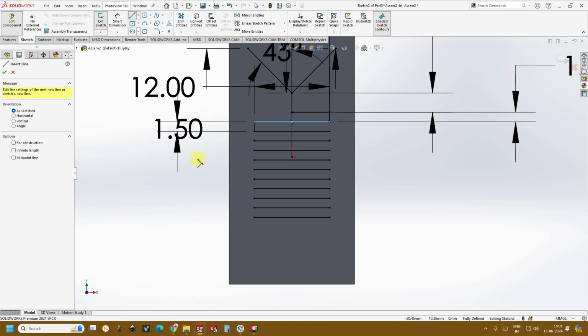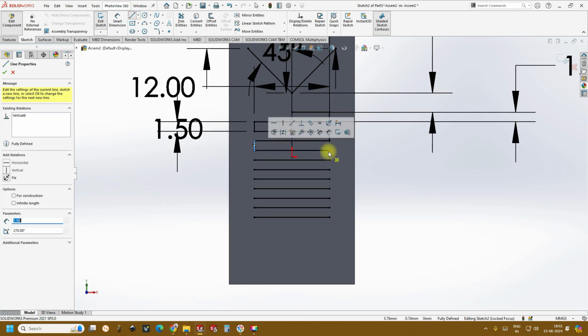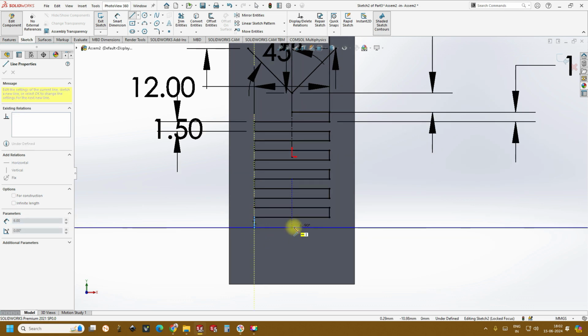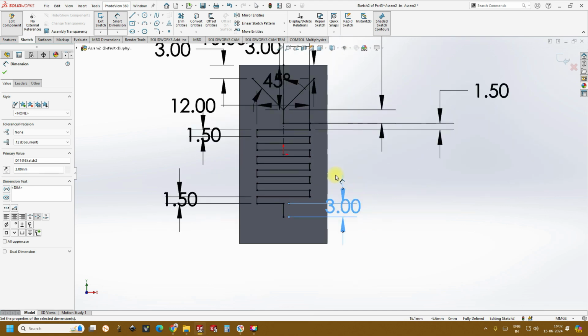Okay, now it is very simple. Just click on the line, just keep connecting alternate lines. This followed by this. And we'll be ending it here. Okay, so now the only thing we have to do is dimension for this followed by dimension for this. So we have almost done.